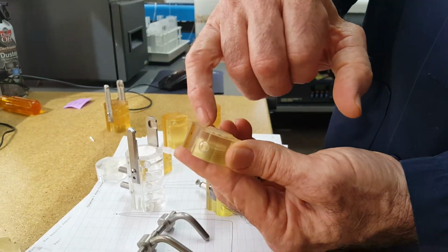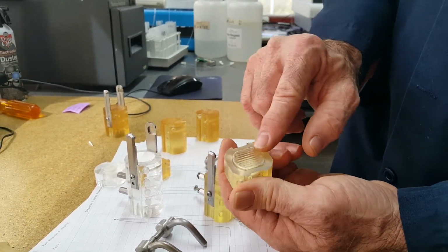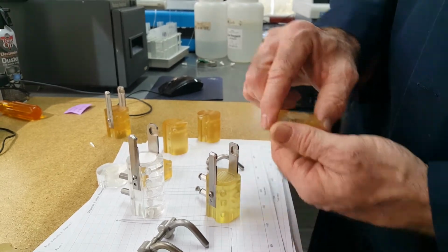And you recall this has the notch on it for the type C membrane. You can still use the round polypropylene on here. It will still work. It will seal.